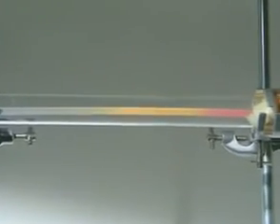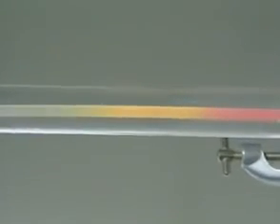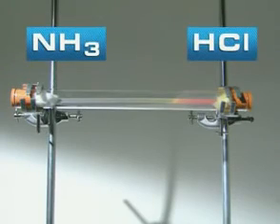Hydrogen chloride gas turns it red. Ammonia turns it blue. Why does ammonia travel faster?